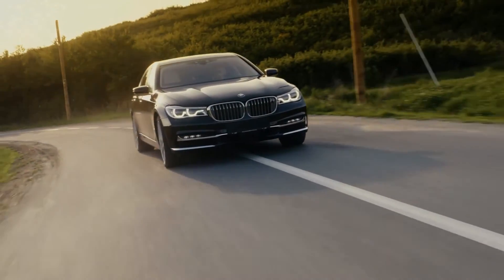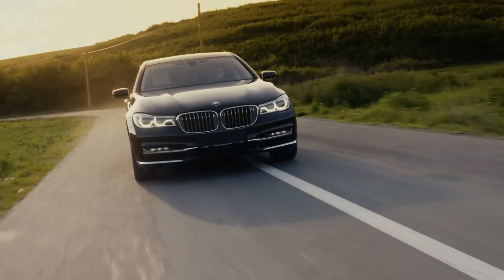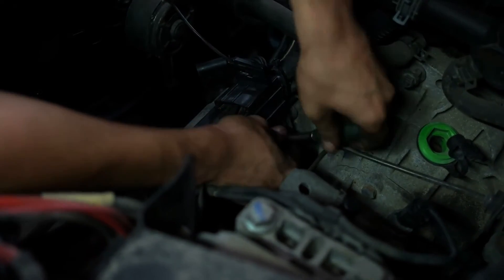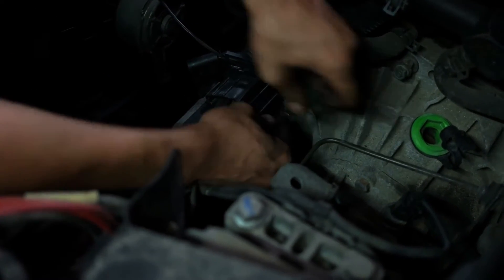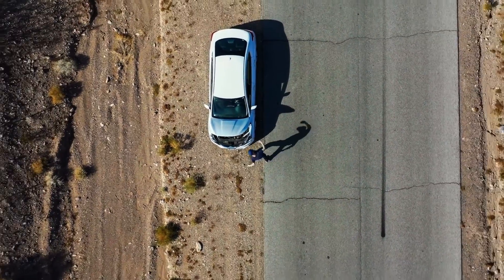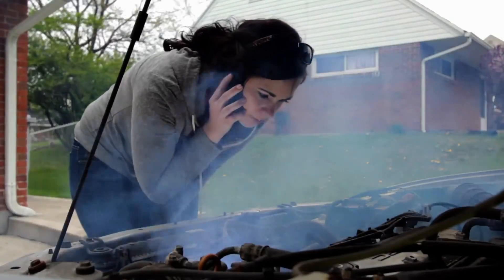The car and the fume hood are both complex mechanical systems. As an operator, you are responsible for how the car is used, but as a driver we would not expect you to fix the mechanical issues — but we would expect you to know when the auto wasn't performing correctly and be able to convey the symptoms.